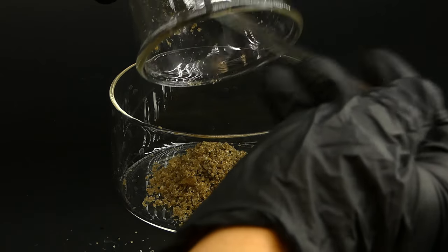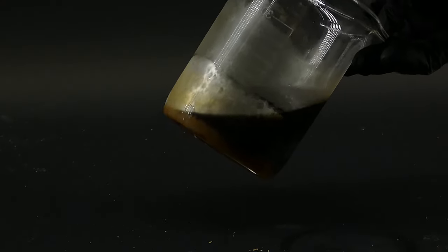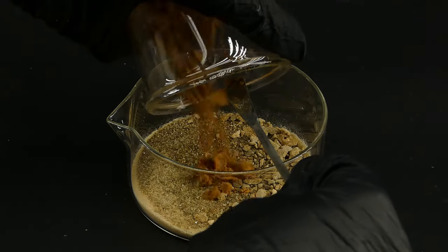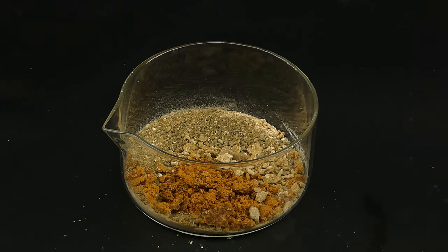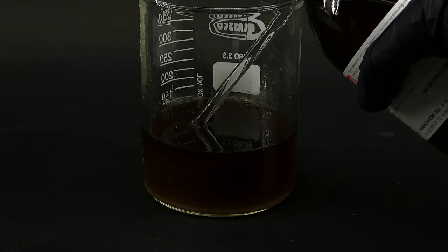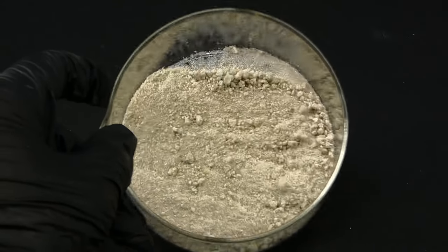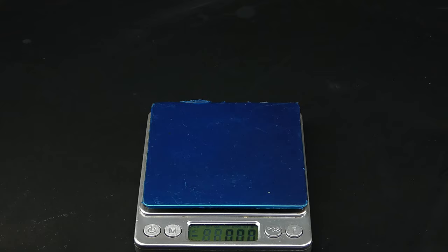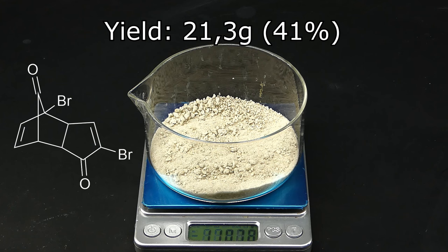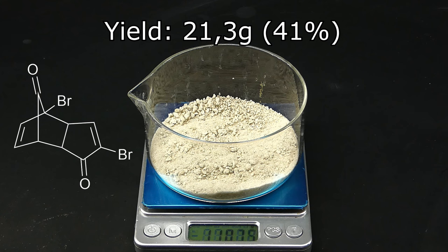They looked really bad, but at least indicated there was hope of getting an actual yield from this mess. To recover more, I boiled down the filtrate, cooled it in a freezer, and filtered out more crystals, repeating this process a few times. After quickly recrystallizing them using more ethyl acetate and hexanes as an anti-solvent, I was left with acceptably off-white crystals. The yield was 21.3 grams of diketone, corresponding to 41% — rather bad considering the literature reports 93% — but after all the accidents and struggles, it's good that I got any yield at all.